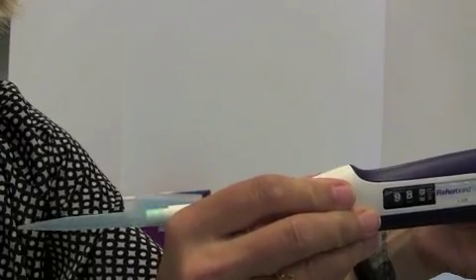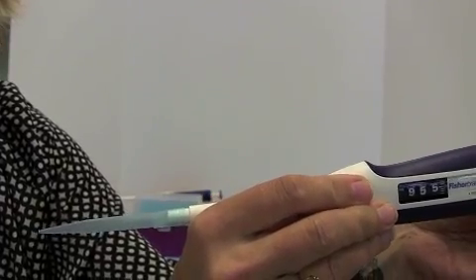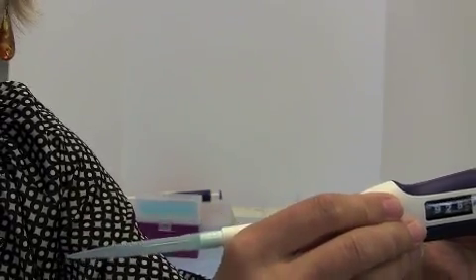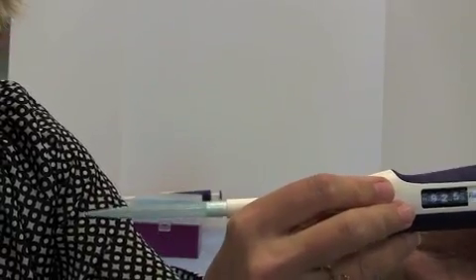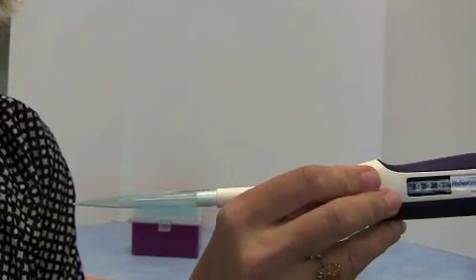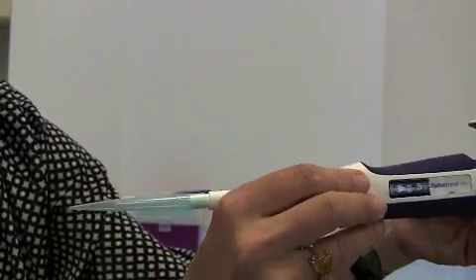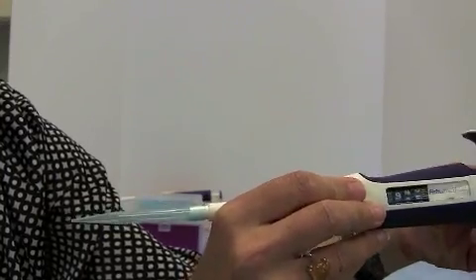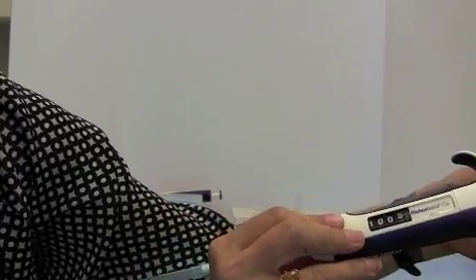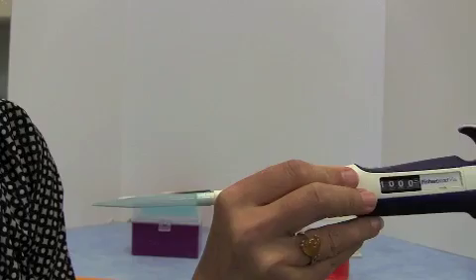And you can adjust that down. So this, for example, will be 955 microliters. This here would be, let's see, 925 microliters. So this would be 0.925 milliliters or 925 microliters. And today we're going to be using volumes of 1000 and 2000 microliters, that is 1 mil and 2 mils. So you're going to have them set to 1000, that is 1000 microliters.